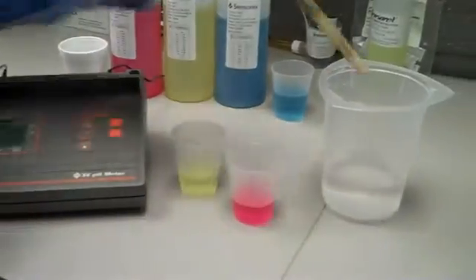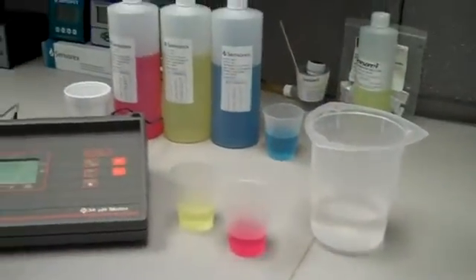Now, my pH electrode is fully calibrated. I can remove it from the buffer, rinse it a bit, and now it's time to take a sample measurement.